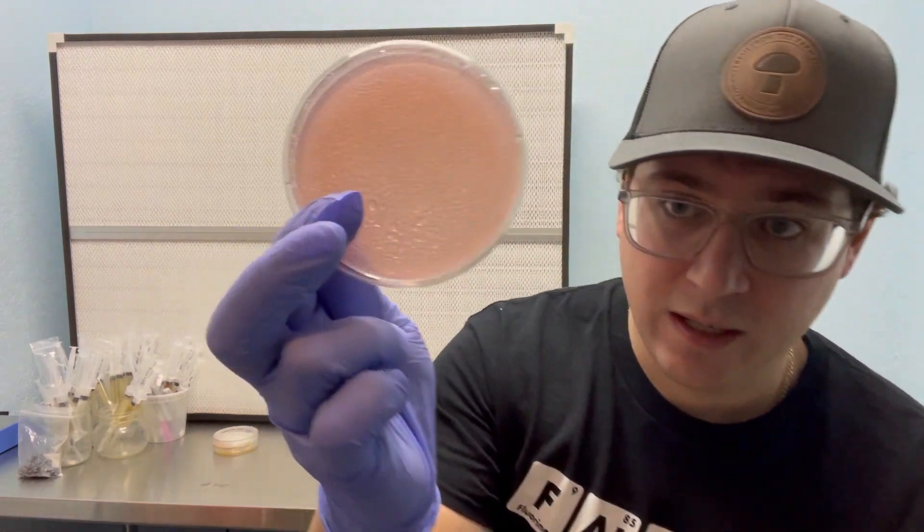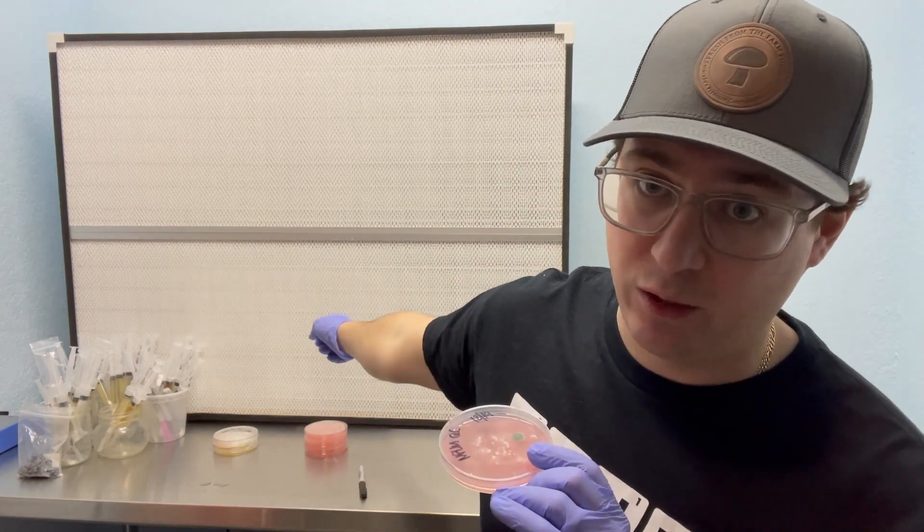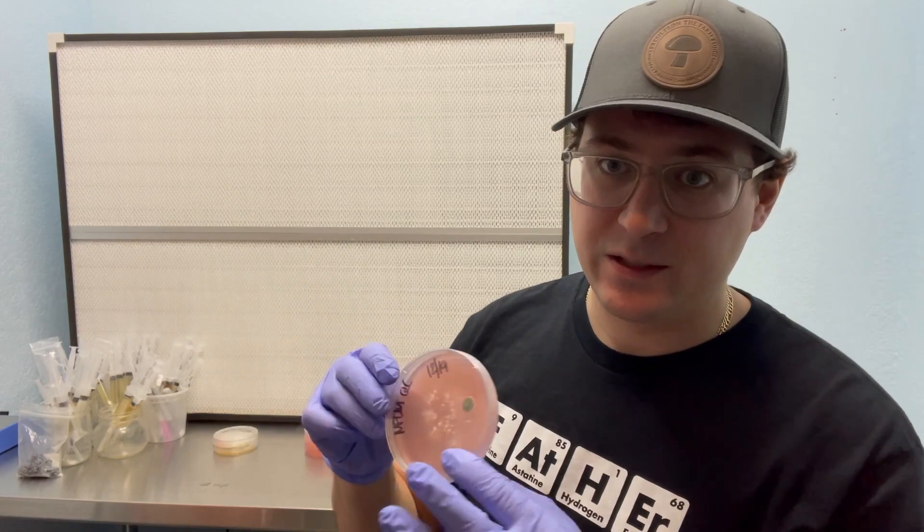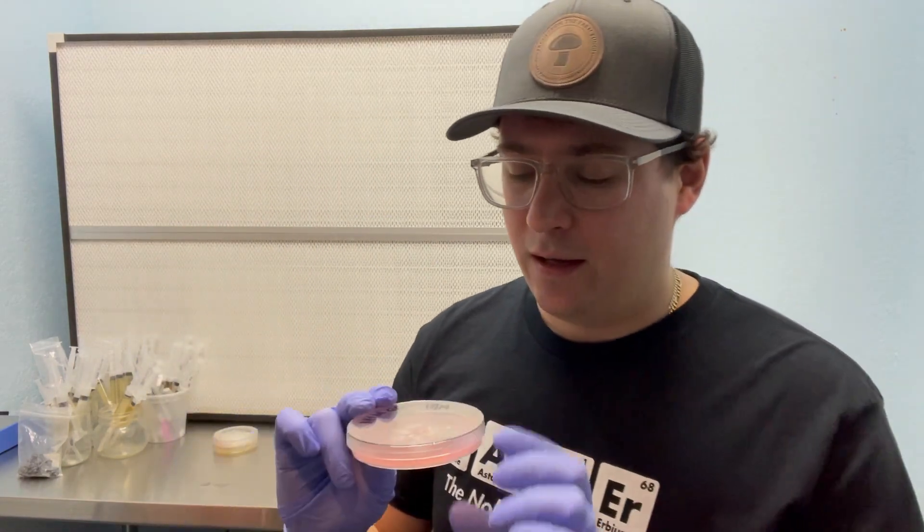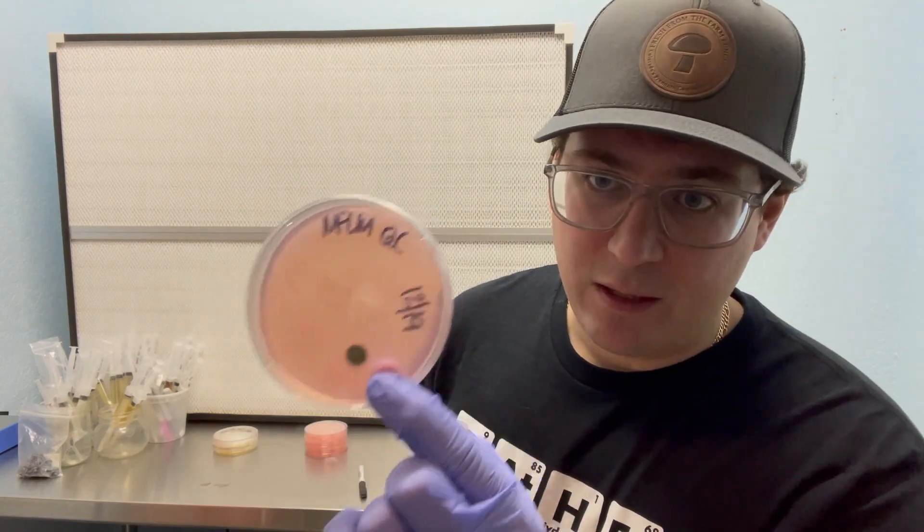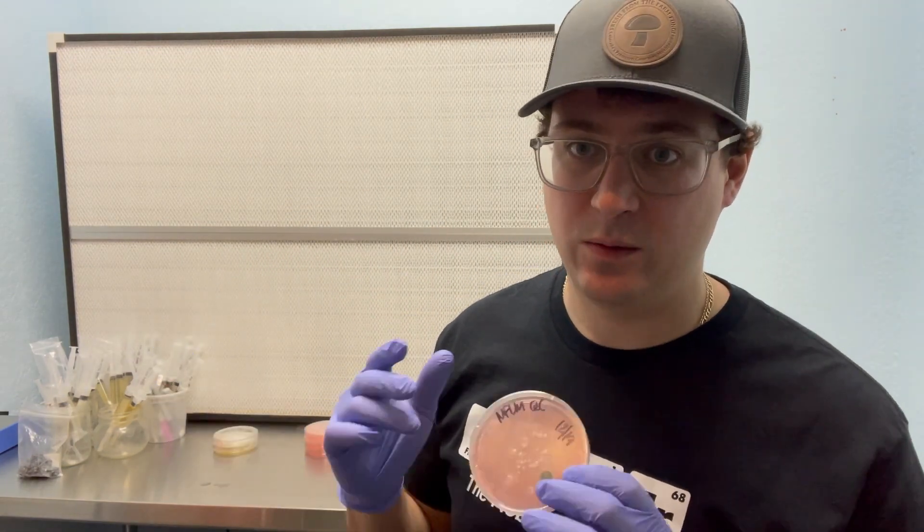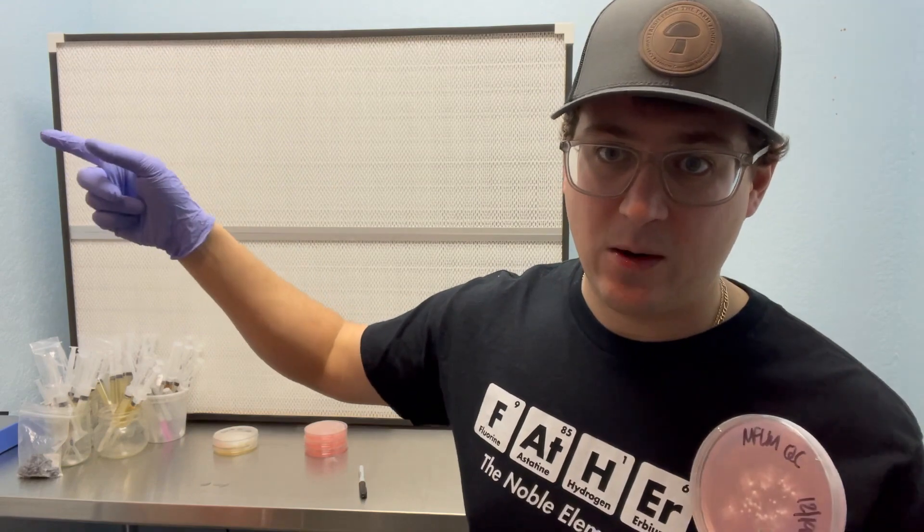So on this dish in particular, I might try to take some mycelium from this edge and transfer it onto a new petri dish. So because I'm working in my lab, I'm not going to turn on my flow hood for this video. That's just going to help blow around those spores, which I'm trying to keep out of my lab.